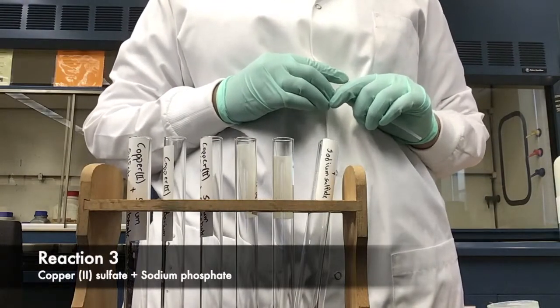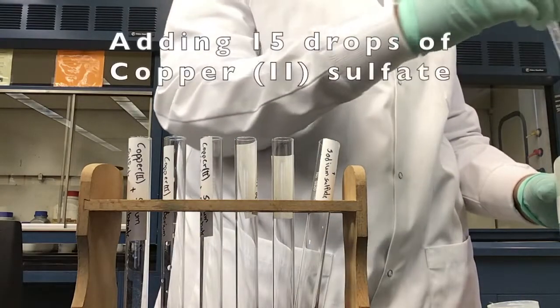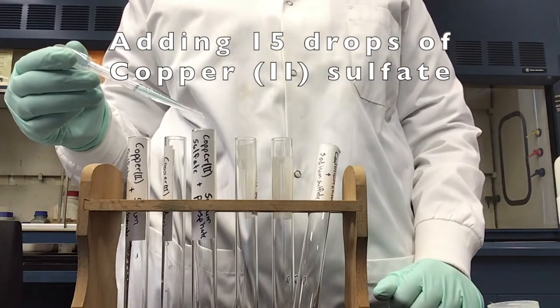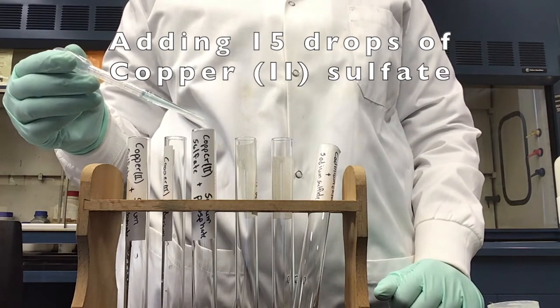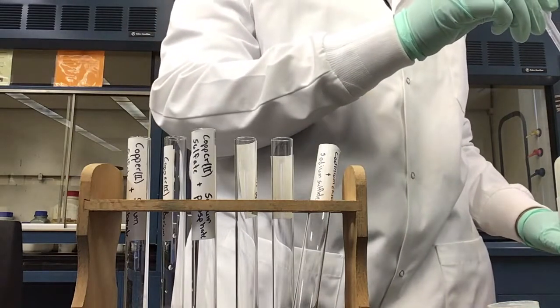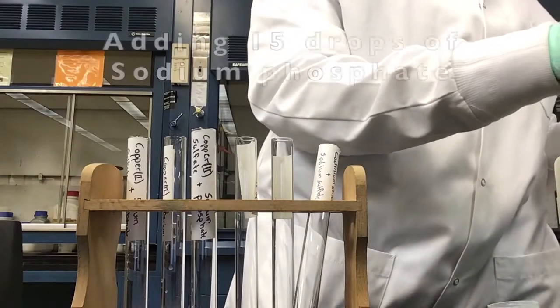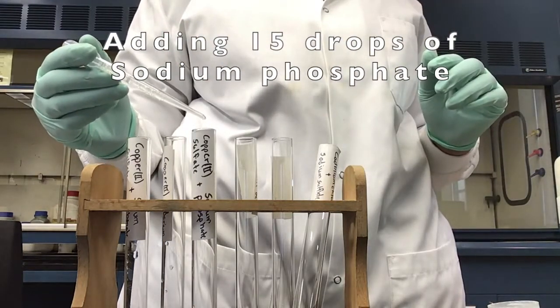Our third reaction is copper 2 sulfate and sodium phosphate. We start by adding 15 drops of copper 2 sulfate to our third test tube. And now we're going to add 15 drops of sodium phosphate to our third test tube.